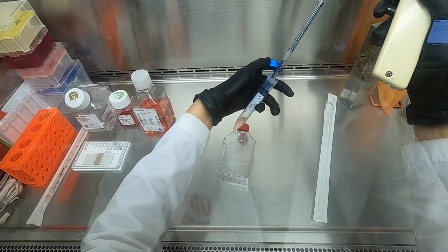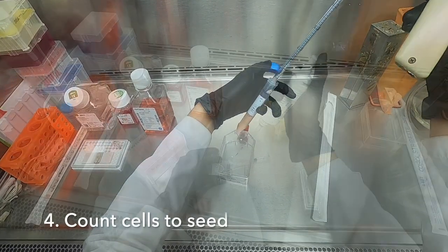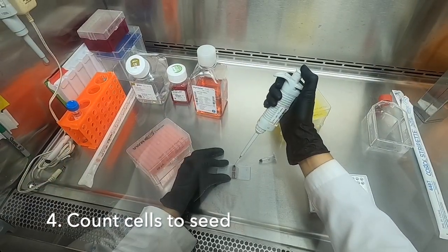Finally, we count our cells using trypan blue exclusion method as described in our previous video. We can then seed the appropriate number of cells and incubate the plate in order to allow the cells to attach.